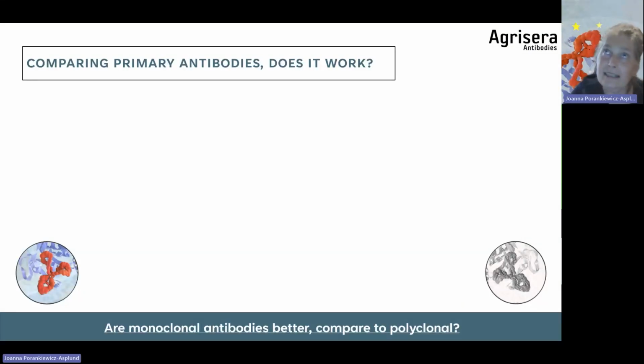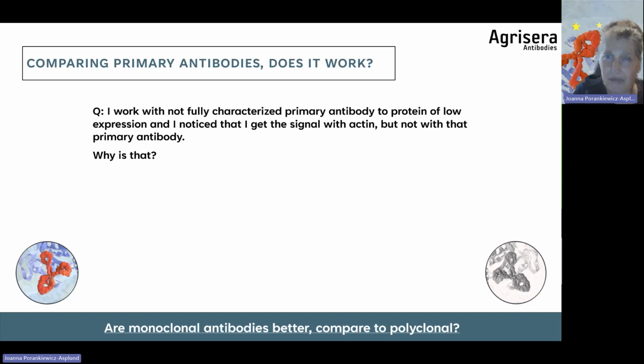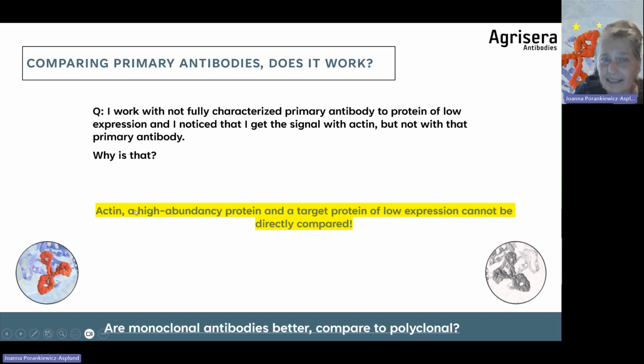In many cases, I see attempts to compare different antibodies with each other. And therefore, I'm bringing up this point: in this experiment, the researcher was comparing a not fully characterized primary antibody with actin. And actin is a high abundance protein, often used as a loading control. And it cannot be compared to a protein of low expression, which may require a longer time to be visualized. So in general, I would treat each protein-antibody pair separately and by the way they are performing, because it depends upon the biochemical properties of your target protein to which the antibody is going to bind. And different antibodies are binding to different epitopes, as you saw.